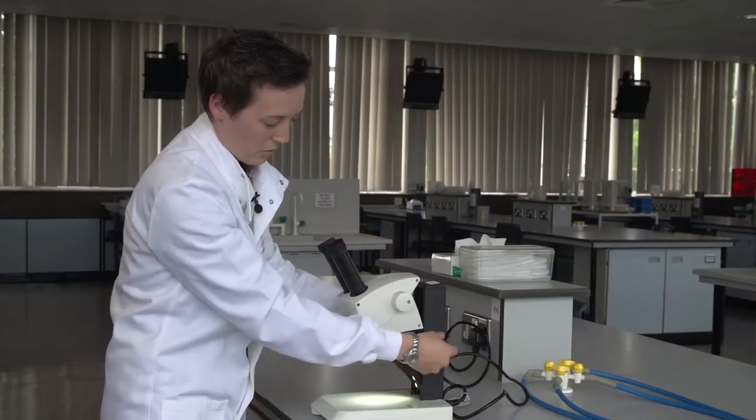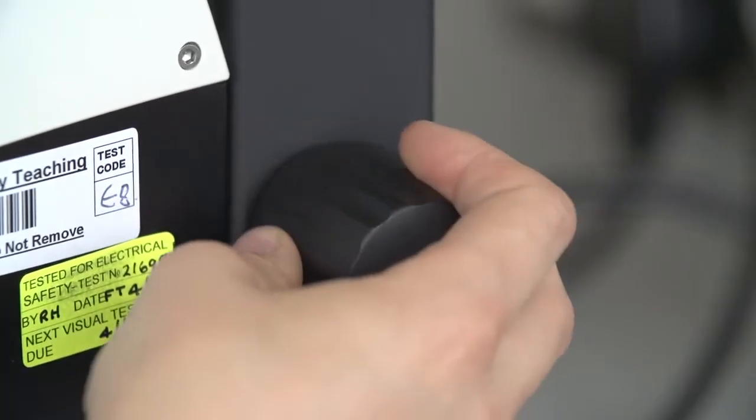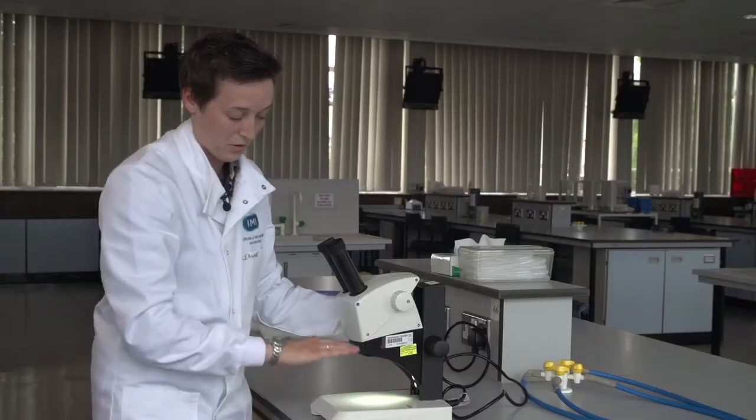Here at the back is where we can change the focal plane and we can move the whole microscope up and down to change our focal plane.